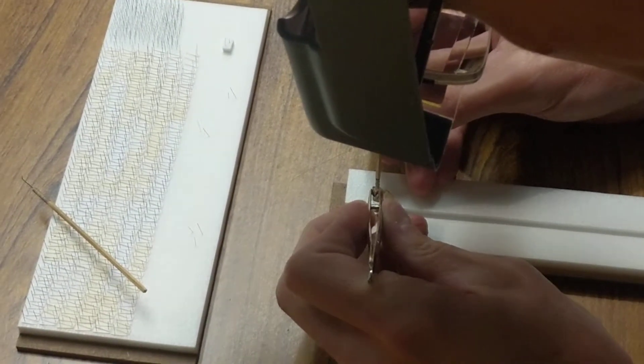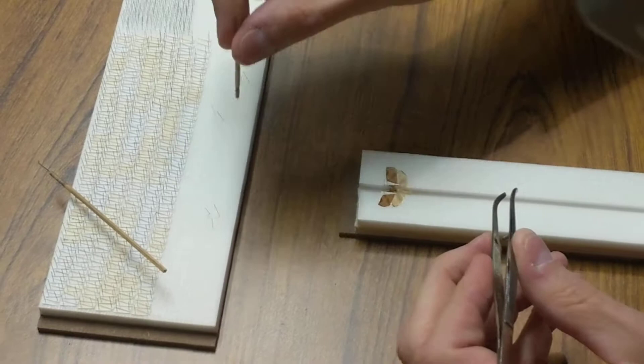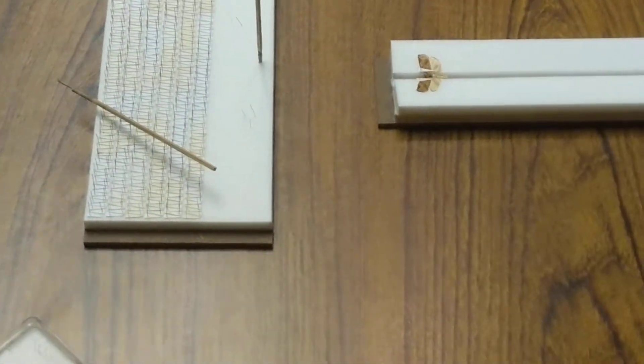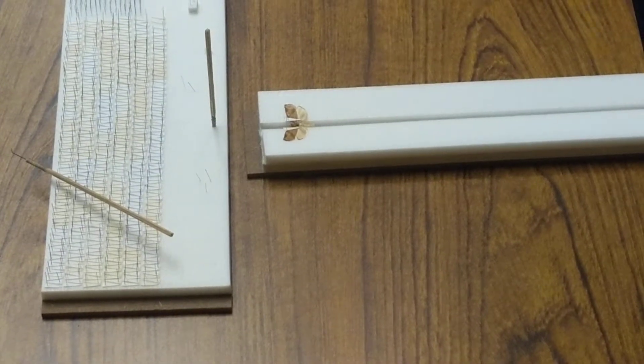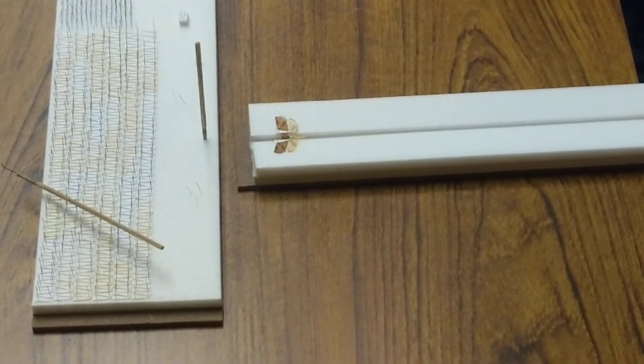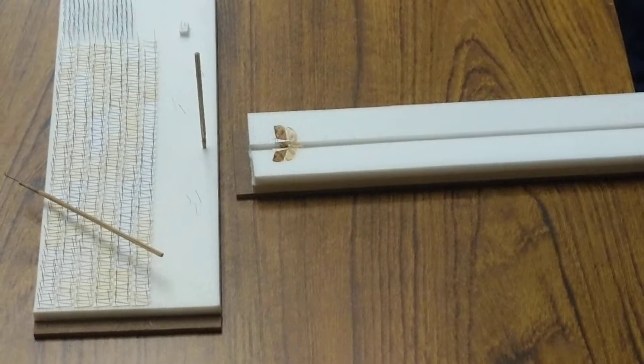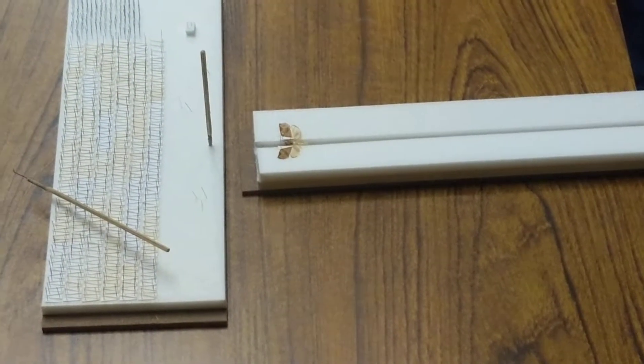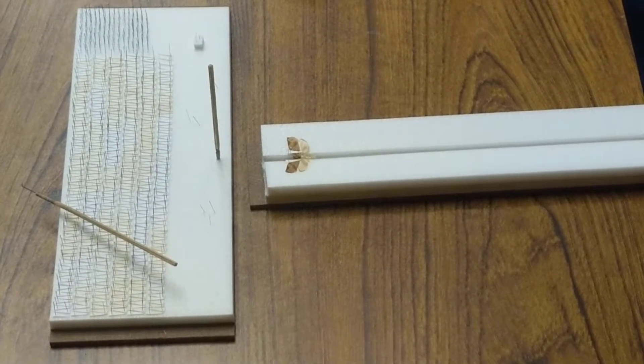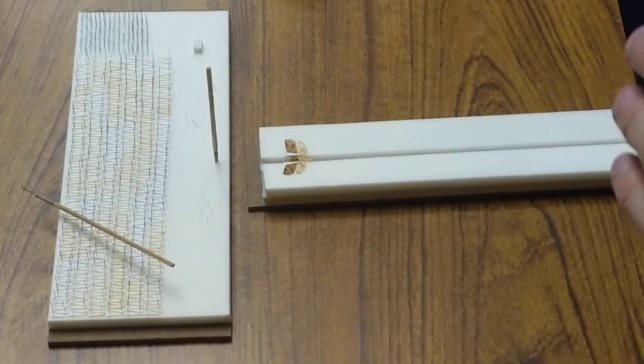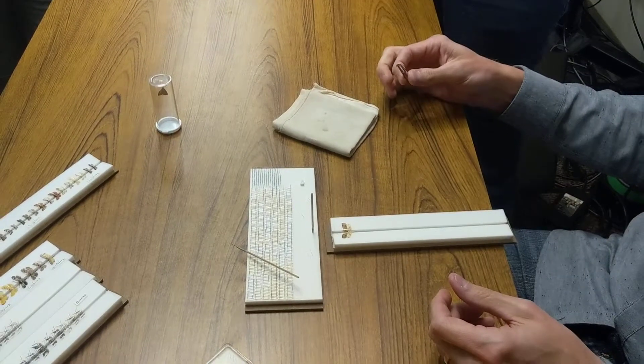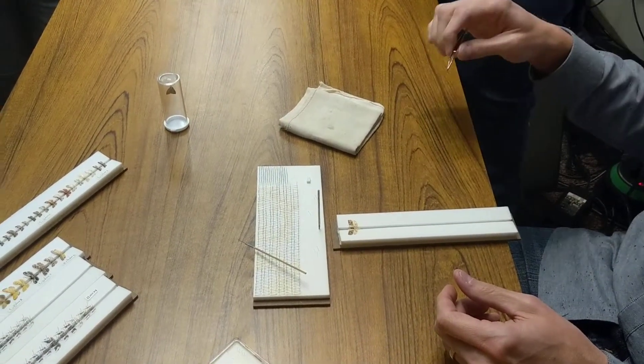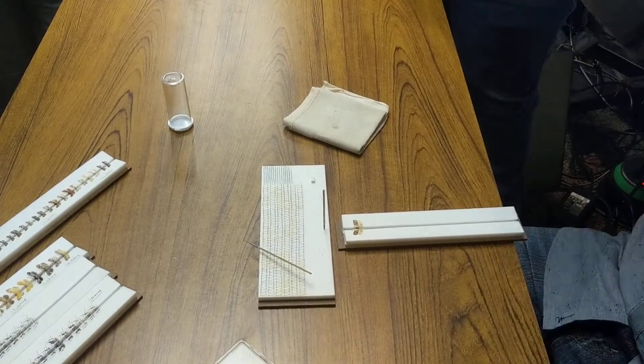Where on the wing are you grabbing it with that minuten? More, this one's so fresh it doesn't really matter, but next to a main vein. The costal vein, the veins along the costa are pretty stout, so right below that's a good area. You don't want to just stick it in the middle of the wing where there's no veins because it'll just rip.